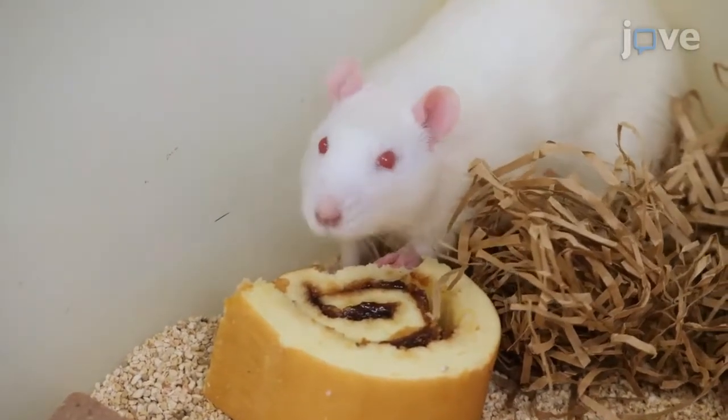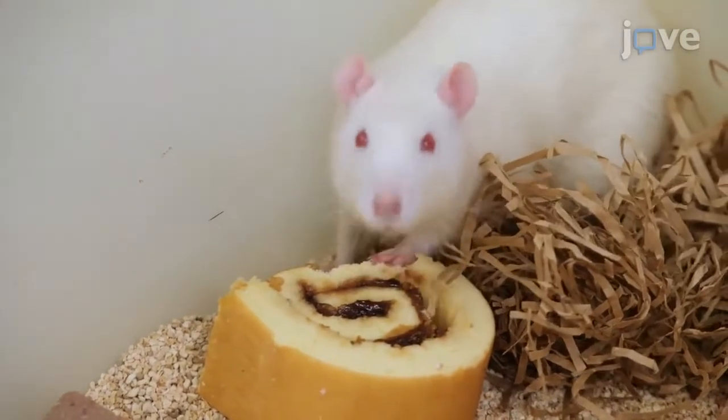Visual demonstration of this method is important because logistical constraints can be demonstrated, as well as how planning and organisation can make the feeding more efficient. Secondly, as the model involves greater interaction with rats, it's also important to demonstrate how to distribute and collect the food appropriately without stressing them.